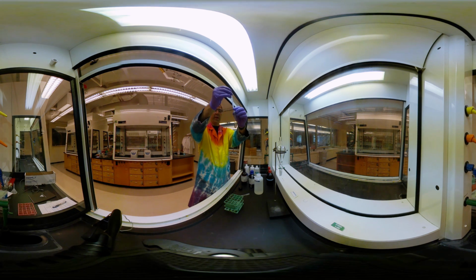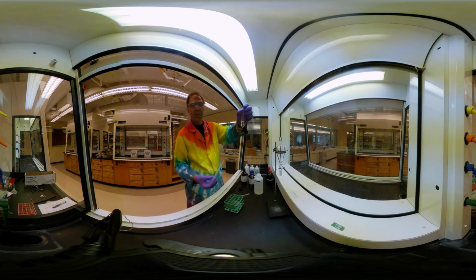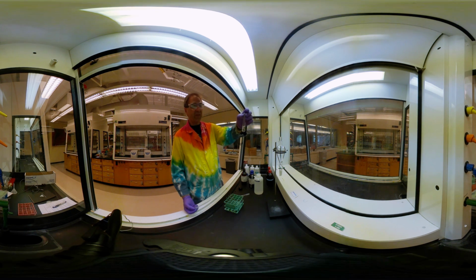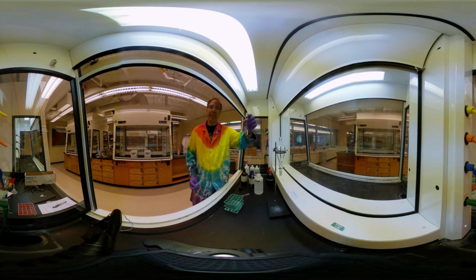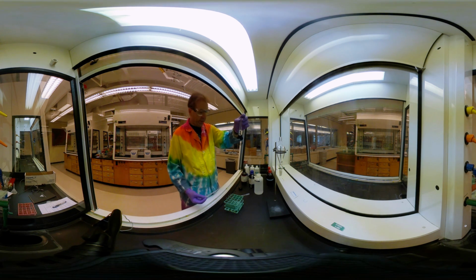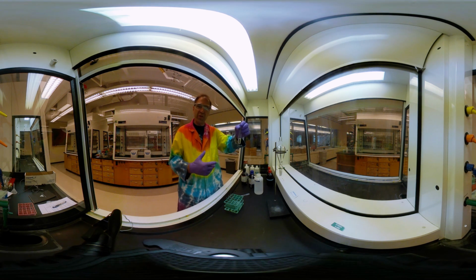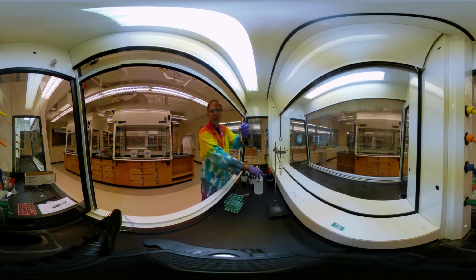All right, now hopefully you can see on the camera that we definitely have 2 different layers here. We've got a bottom layer and we have a top layer. The question that we ask, though, is which layer is which? Now you can use the densities to give you an idea of where to start. And the density is a really great way to look at it. The problem with density is that if you have enough of your solute dissolved in a particular layer, the densities can actually flip.